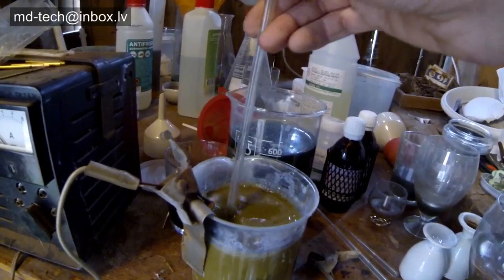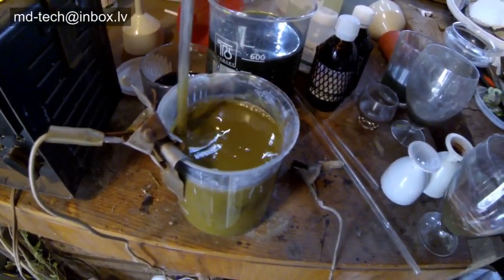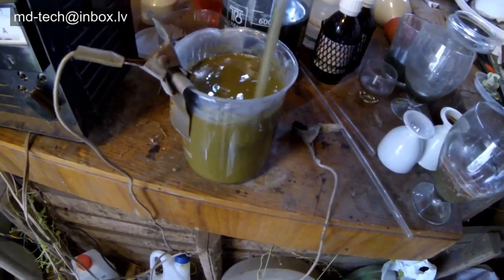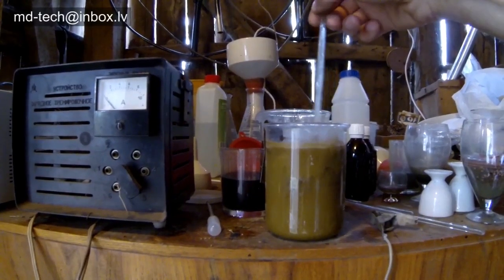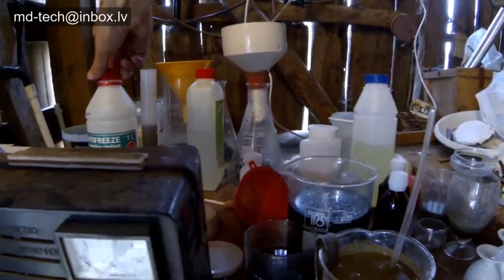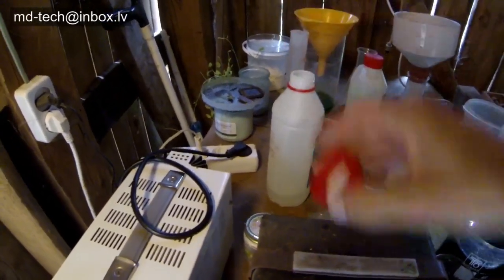The liquid very quickly turns heavy and needs to be filtered or have acid added to dissolve the metals. In this process, sodium chloride forms sodium hypochlorite, and hydrochloric acid forms chlorine, and the solution turns clear.